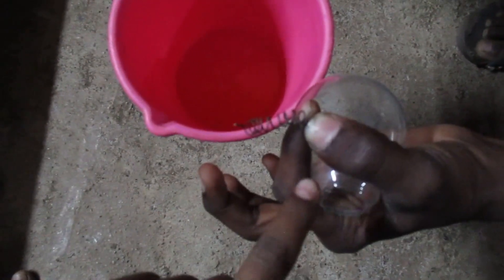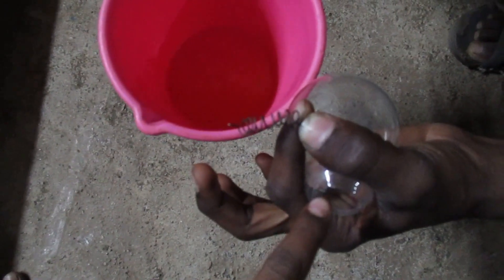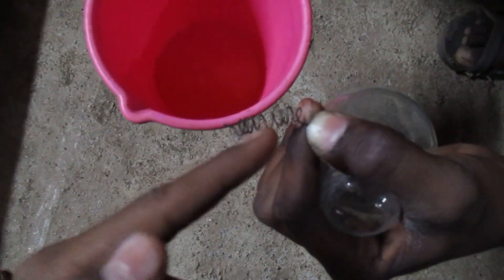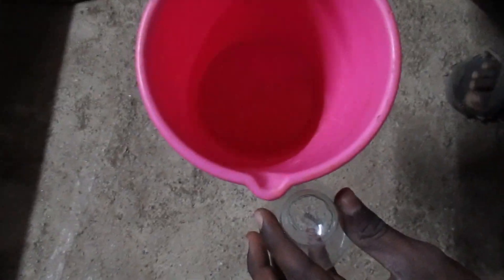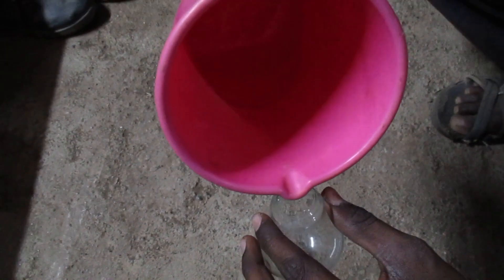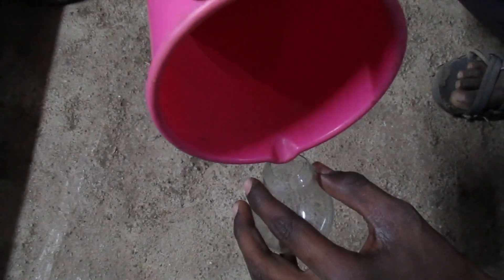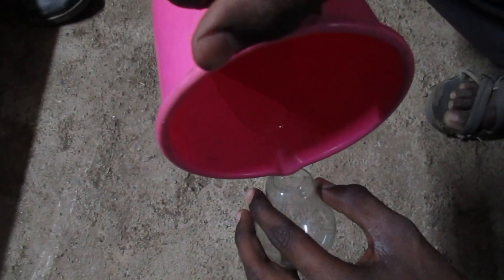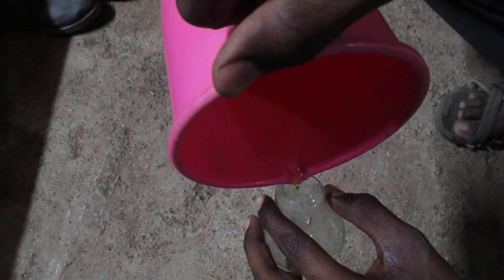So this is the hydrochloric acid, this is the test tube we taken out from a light bulb, and this is the tungsten. Let's start. First, pour in the hydrochloric acid into the test tube — we are pouring it slowly. It's very dangerous.